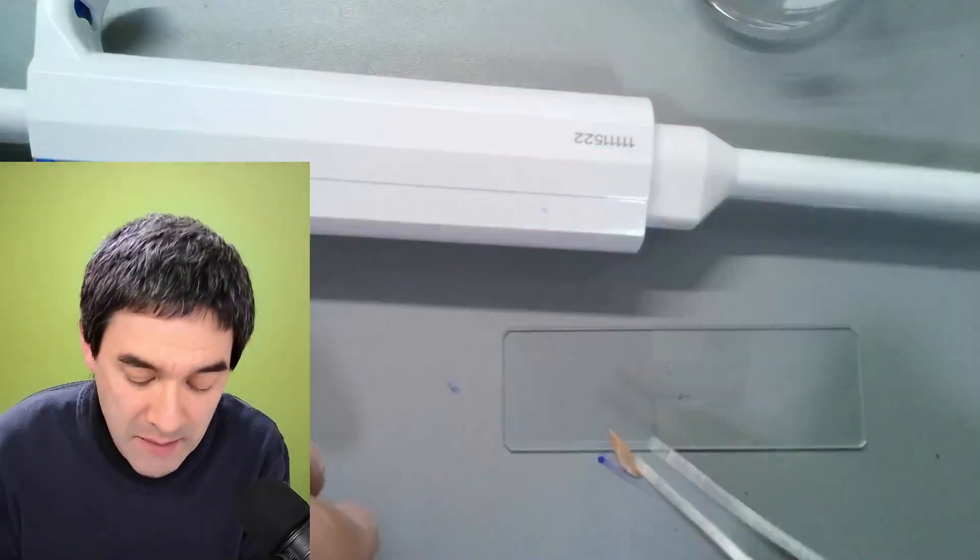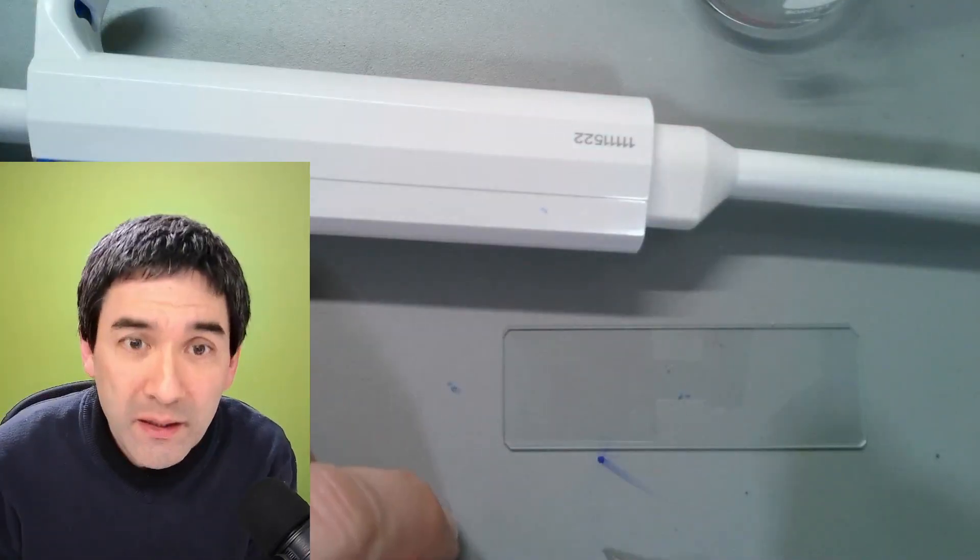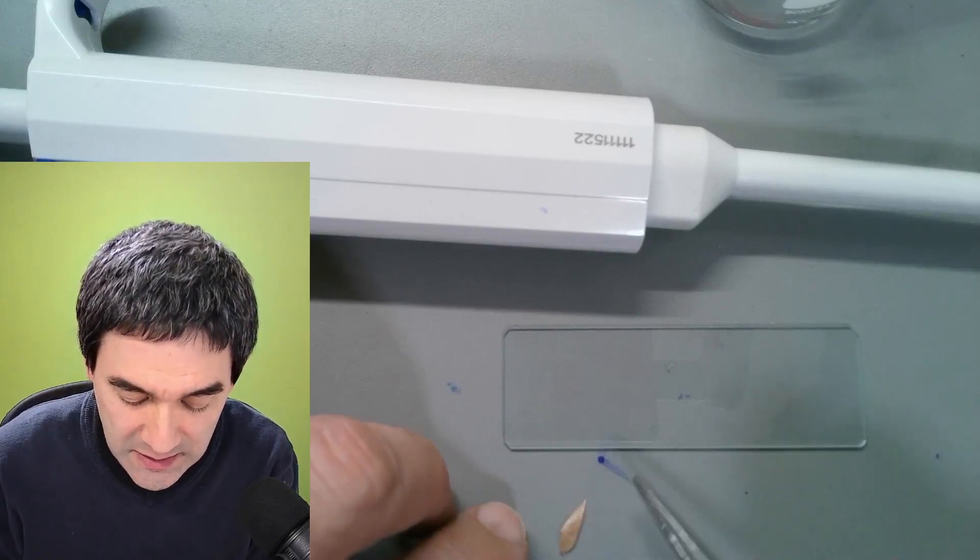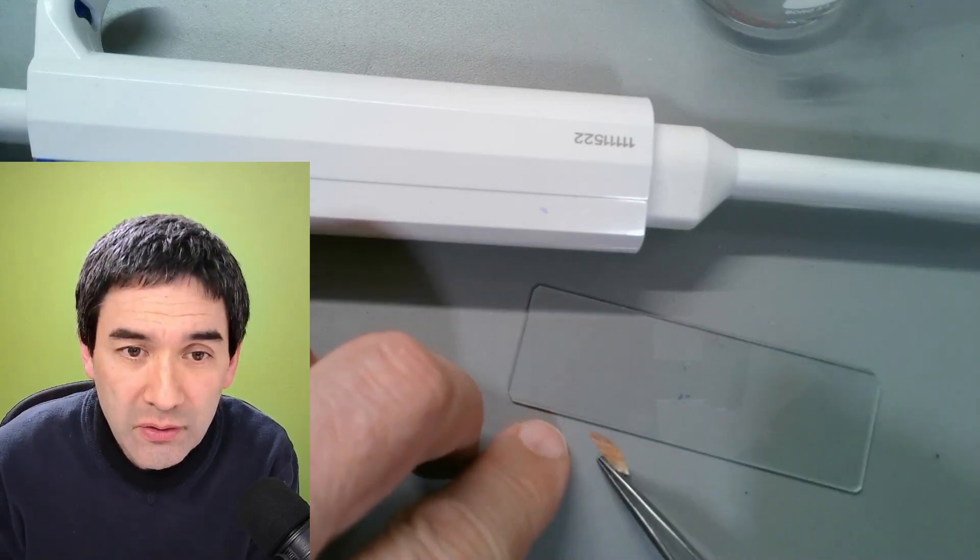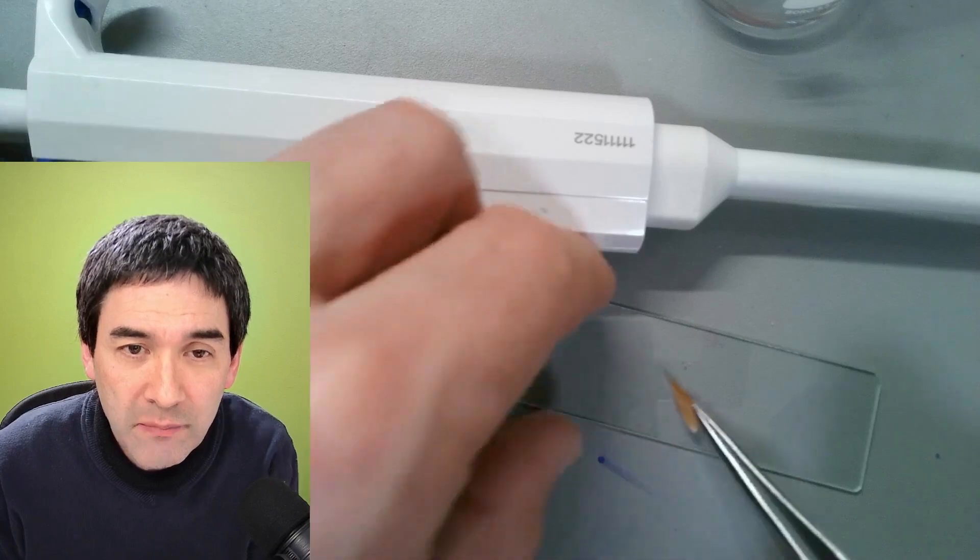essentially make a wet mount and here it is again. It's kind of difficult to catch here and here we go.